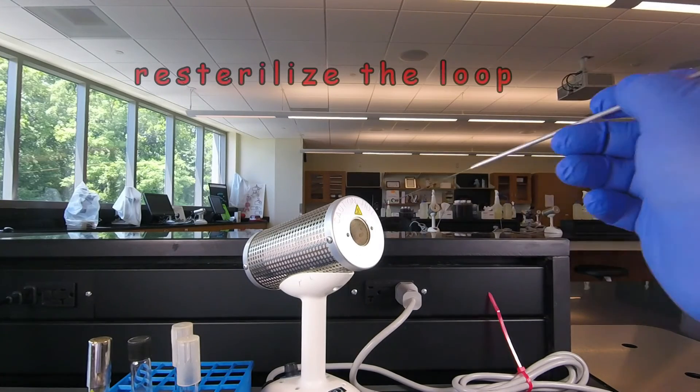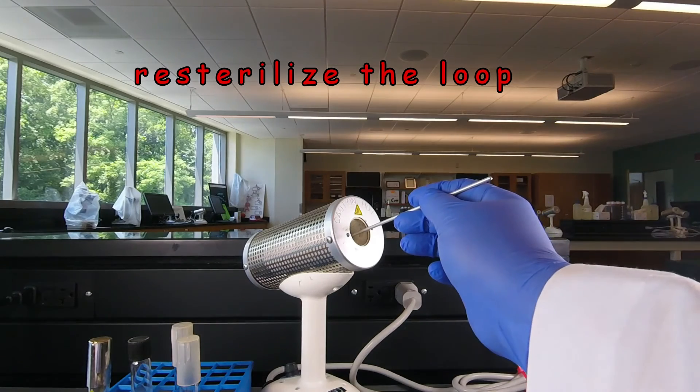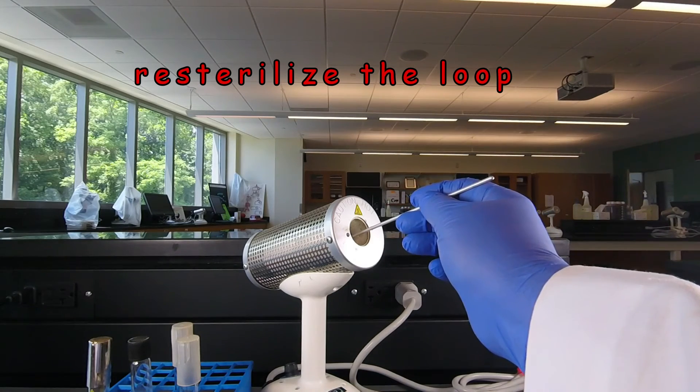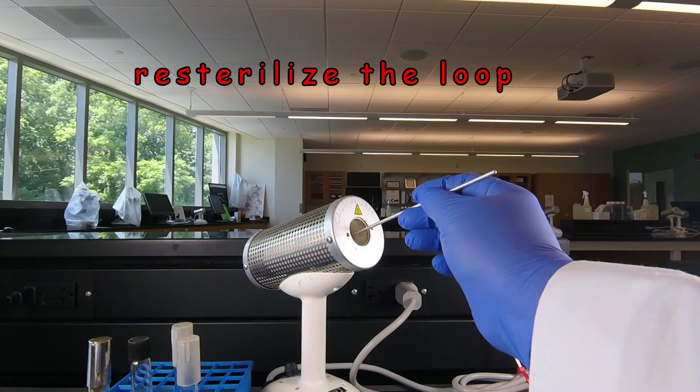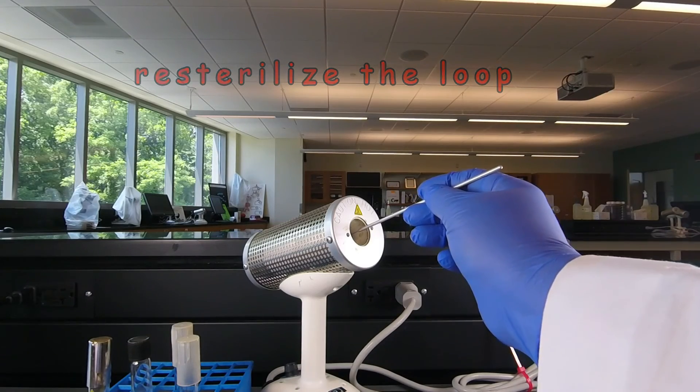Of course when we're all done we need to re-sterilize the loop for ten seconds.